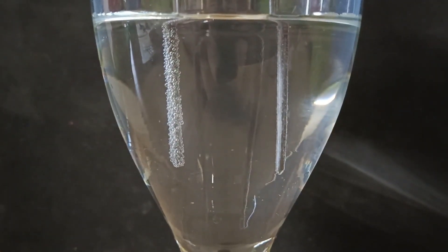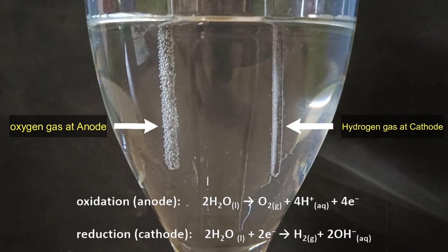To observe the bubbles of hydrogen gas and oxygen gas very clearly, let's have a background which is black.